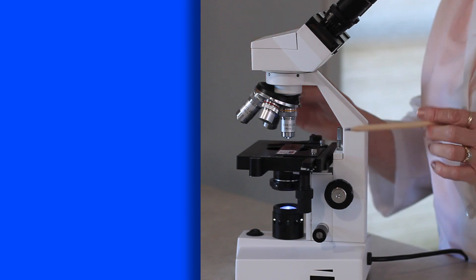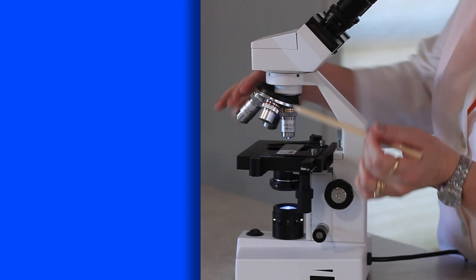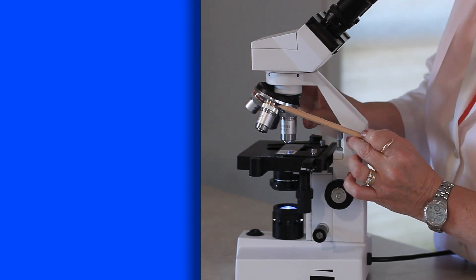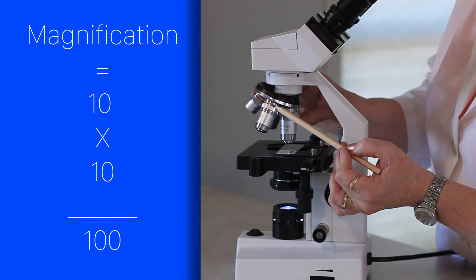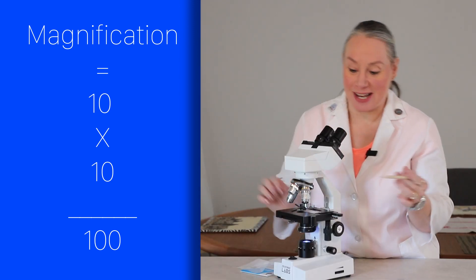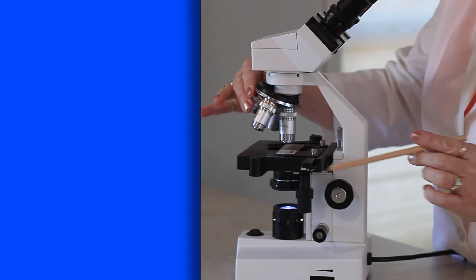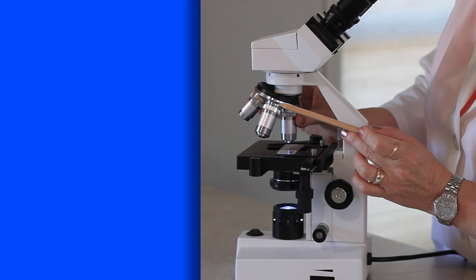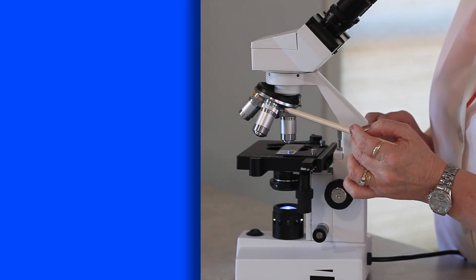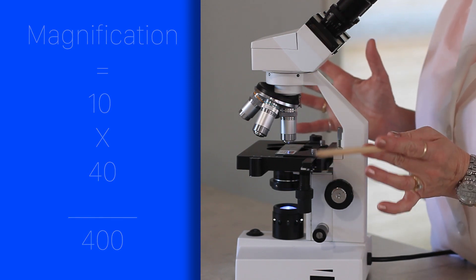Then, as I get that into nice focus, I will be able to go to the next ring, which is the yellow ring. This is 10 times magnification, so 10 times 10 is 100 — we have 100 times magnification. Get it in nice focus, then we can go to the blue ringed objective, which is 40 times. 40 times 10 is 400 times.